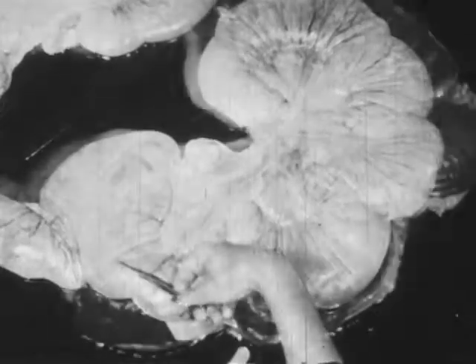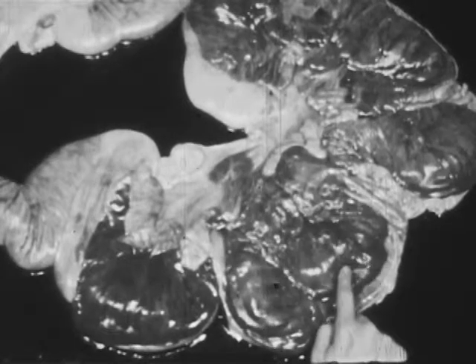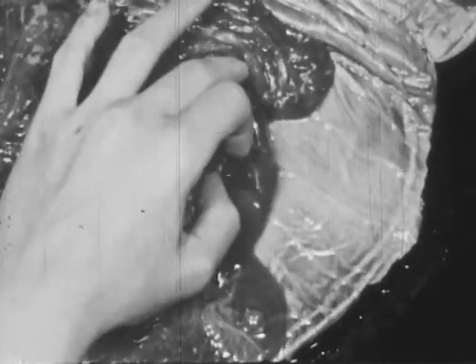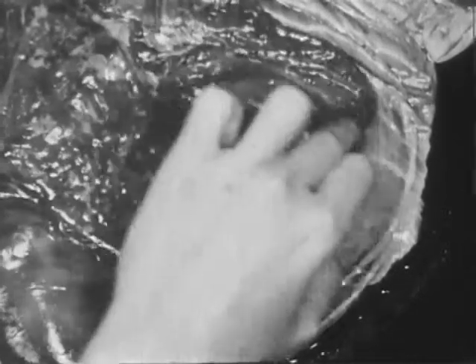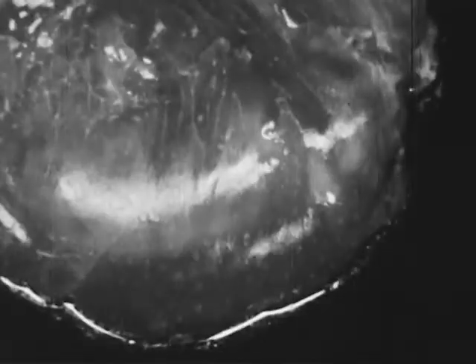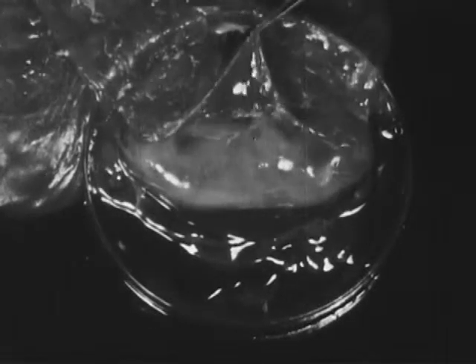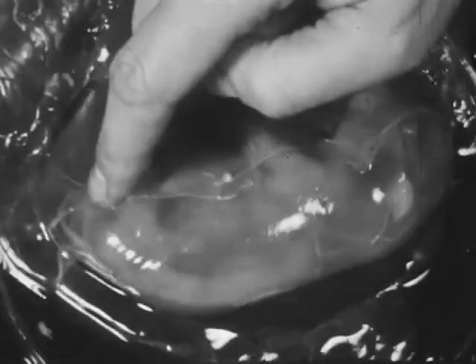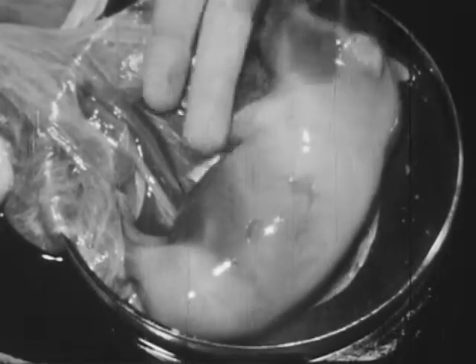Cutting the wall of the uterus reveals that the fetal pigs are enclosed in membranes. The outer membranes and the lining of the uterus are in close association with each other and together form the placenta. Cutting the outer membranes and laying them back exposes an inner sac containing a watery fluid. This fluid cushions the fetus against shock. Puncturing the sac allows the fluid to escape, and laying the sac aside shows the umbilical cord, which connects the fetus with the placenta.